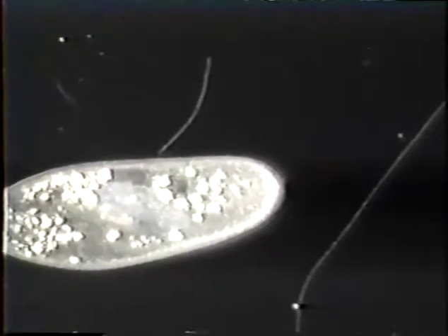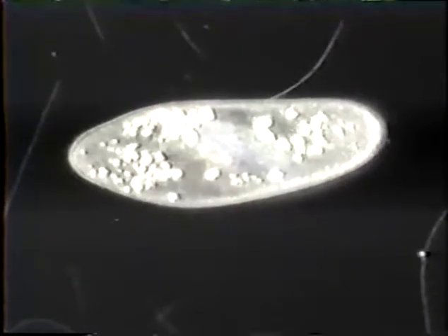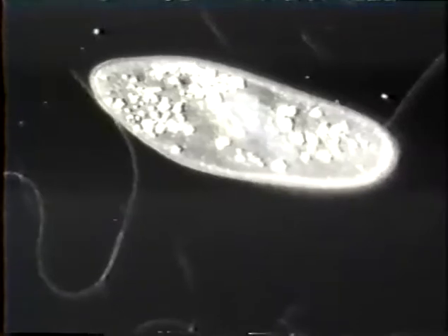It becomes somewhat confused. This is typical of paramecium when under the influence of their MOR. It takes a few minutes to get here. These organisms do have a very simple nervous system.